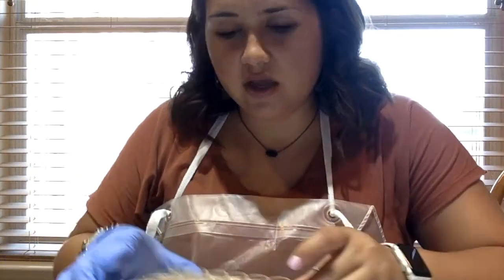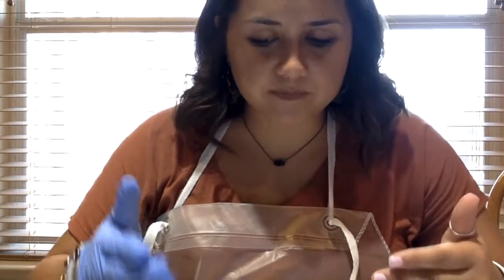So now I am performing activity 2 of lab 6 on buffered solutions. I had to step away for a little bit, and so I remade some of my solutions, but I did go ahead and do the first part of activity 2, and so I did my dilutions and everything. This first row is my kind of indicator row, and the first row is the undiluted, and each of the next rows are the dilutions of each other dilution.